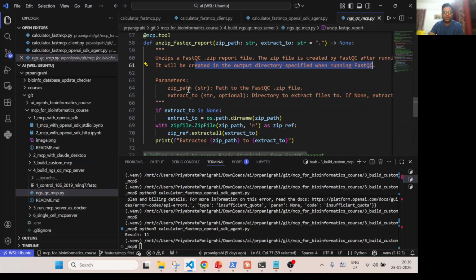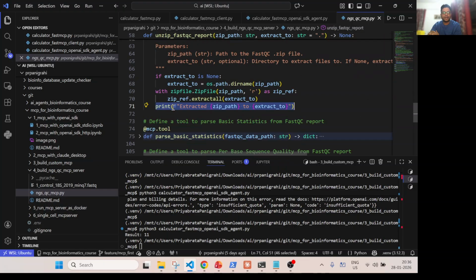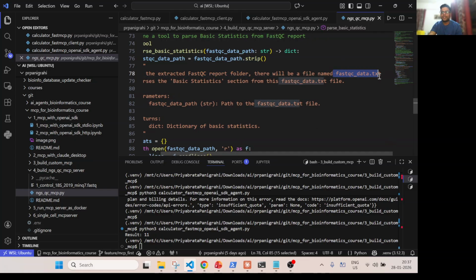Okay, so now it's basically very simple. I'm doing a zip extract all, and finally I'm giving a response that it is extracted. Okay, so in the third thing, once extracted, it will create an extracted folder. There will be a file called fastqc_data.txt. So that's what I'm telling: in the extracted FastQC report folder, there will be a file called fastqc_data.txt.